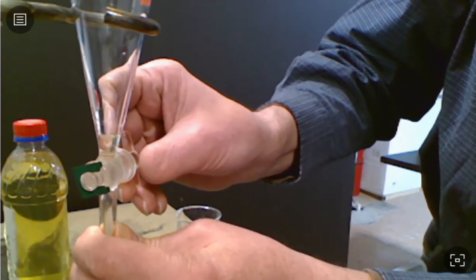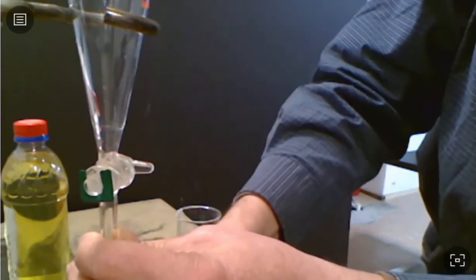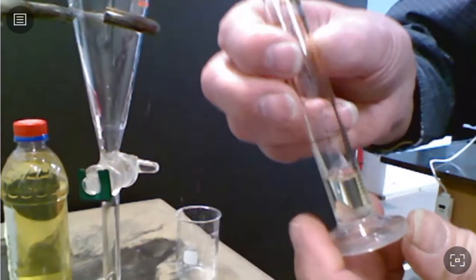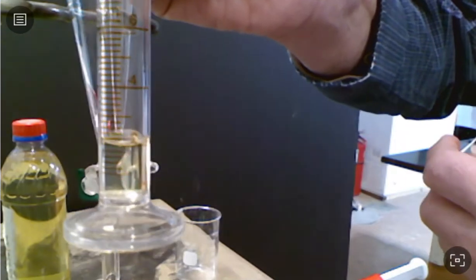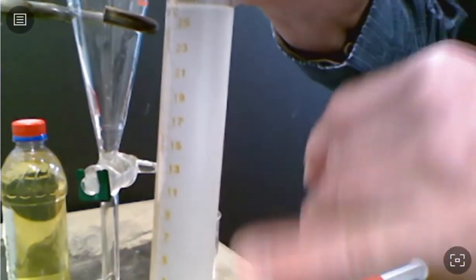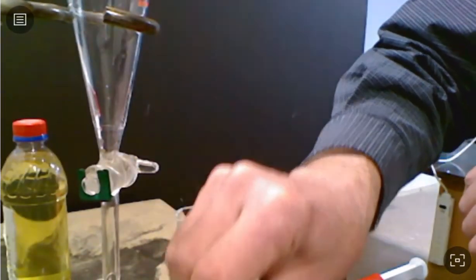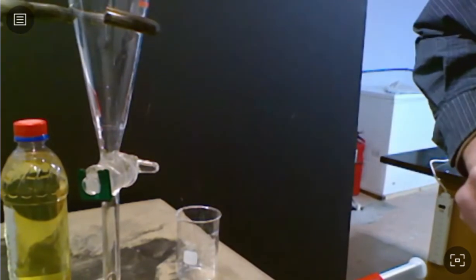now. Just let it completely drain out. There. And our gasoline layer started with 20 mils, and look at that. It's got 2 mils left. That is it. Now, granted, some of that gasoline is in here, because if this was just all ethanol, it wouldn't be cloudy. So there's a little bit of gasoline in there in emulsification. But we have gone from 20 mils to a 2 milliliter volume of that gasoline layer. All right, now I'll show you what it looks like to test it.